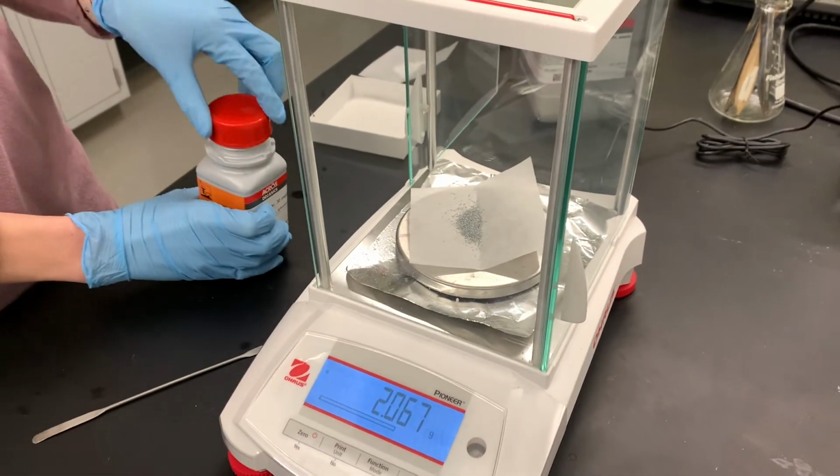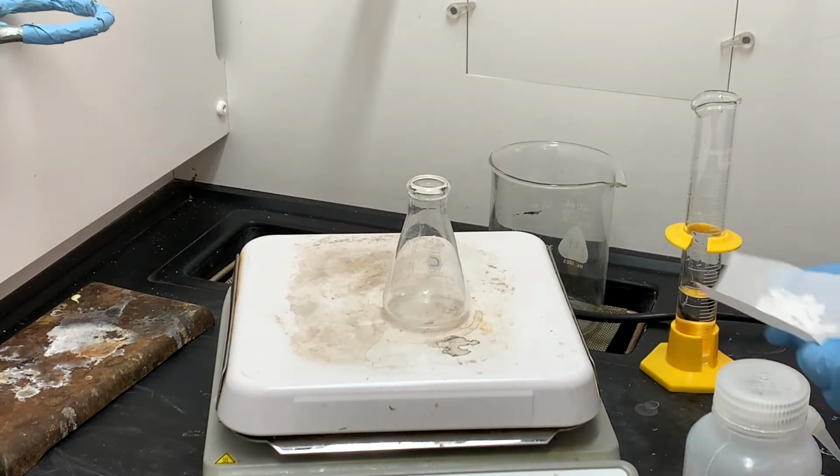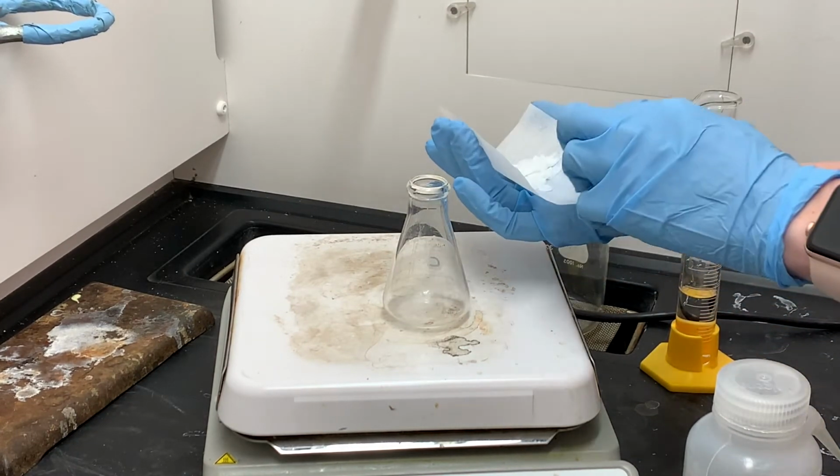Quite a bit more, but that's fine. 2.067.